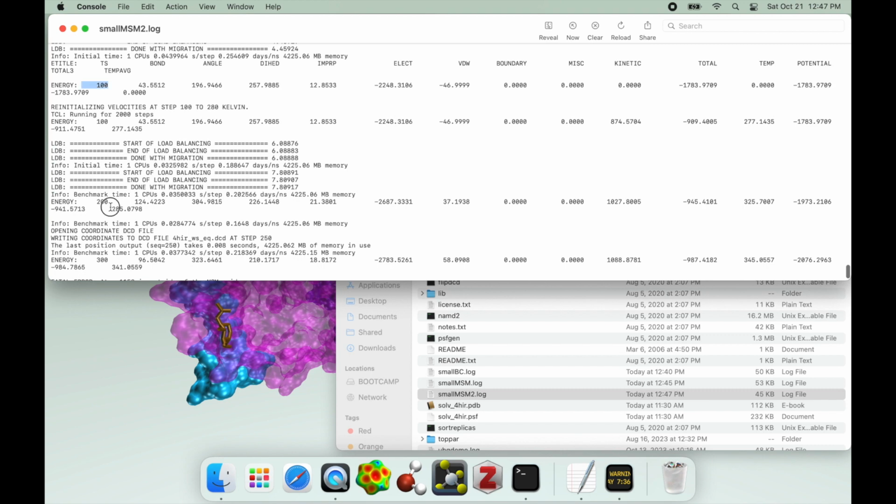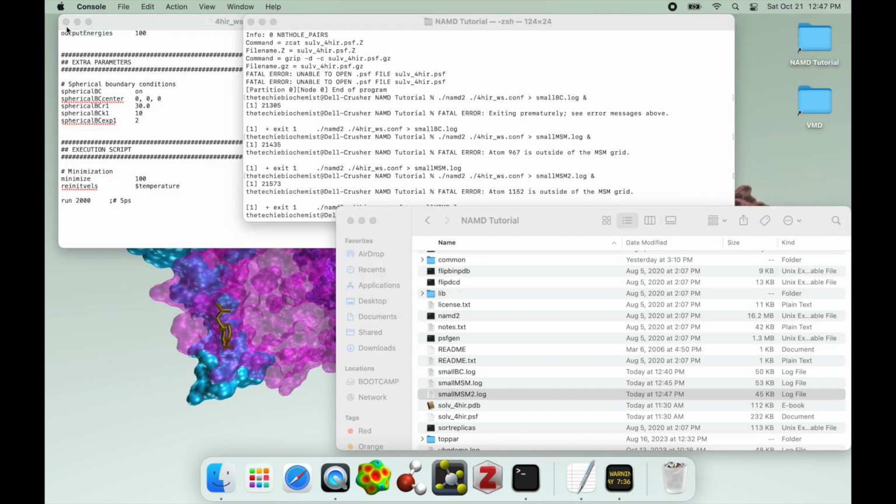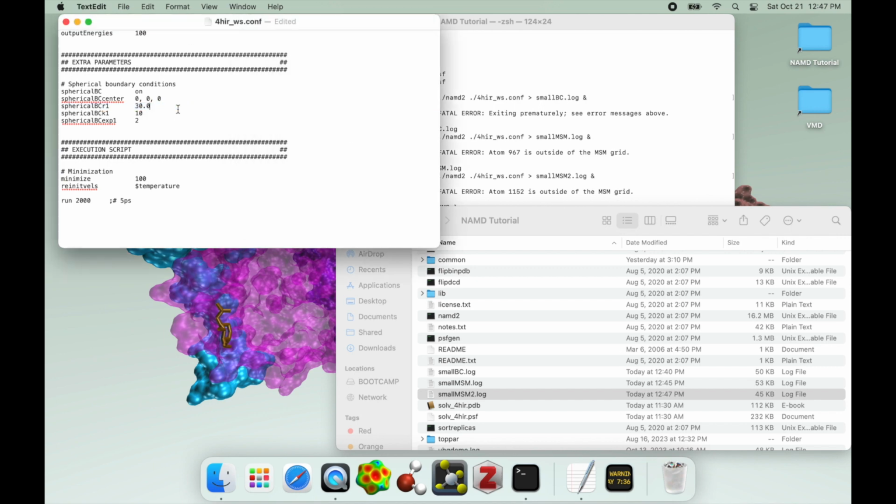Yeah, there were 100 minimization steps. It didn't hit it immediately. It got to 200 steps, and then at 300 steps, there we go, fatal error. So as you can see, the smaller the MSM grid is, the more likely you are to hit that error, and the quicker it's going to happen, or is likely to at least. The two ways you can work around that is by just increasing the MSM grid. You want it to be like 5 to 10 angstroms larger in all directions than the spherical boundary control radius.